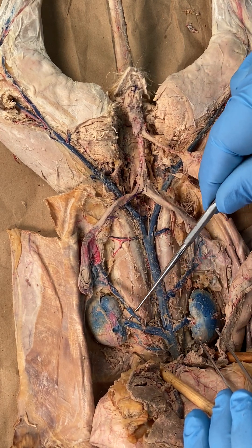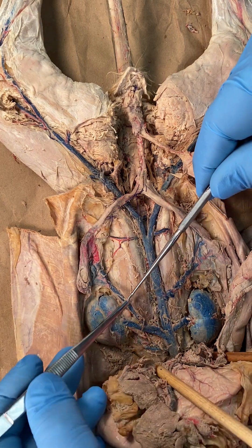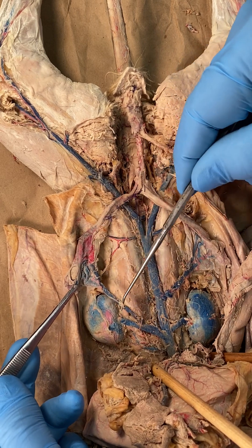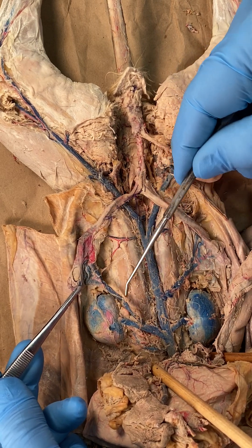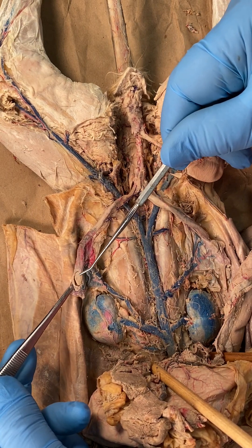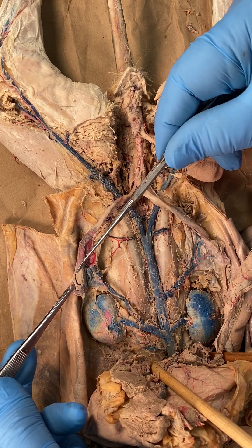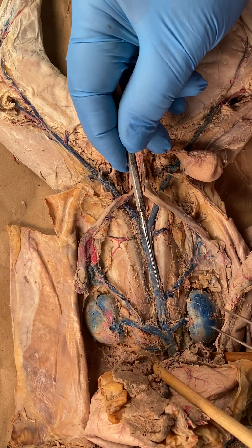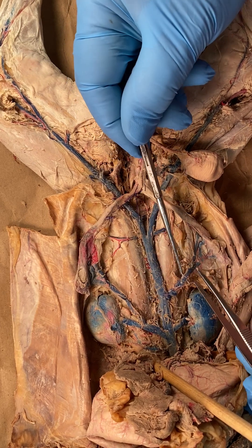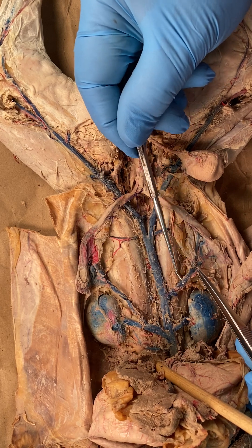Look at that huge vein going into the left renal — it identifies what that vein is named. Since this is a female cat, it's ovarian rather than just genital. That is the left ovarian vein. On the right side, the ovarian does not come off the renal — everything's reversed when we talk about veins — and there's the right ovarian vein.